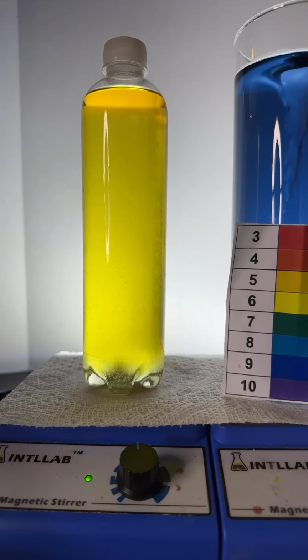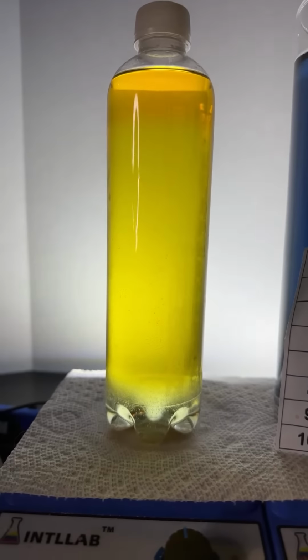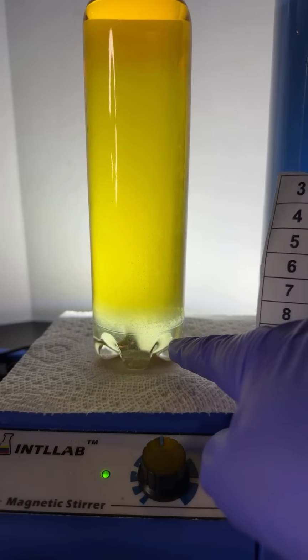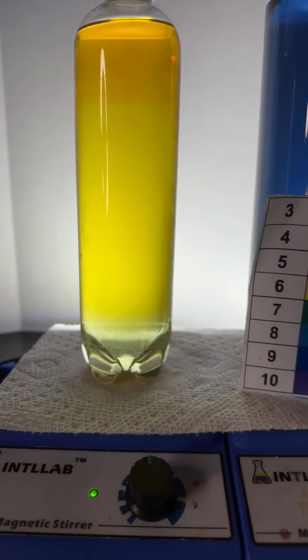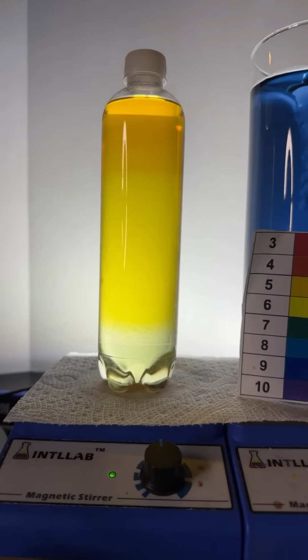That's looking pretty, though. Boy, you can really see the 3 layers really nicely. I see the alcohol layer, I see the water layer, saltwater layer, and I see the emulsion really well. Craig, the dye that I'm using is Universal Indicator. It's actually a mixture of 4 different dyes, but you can just buy the bottle.